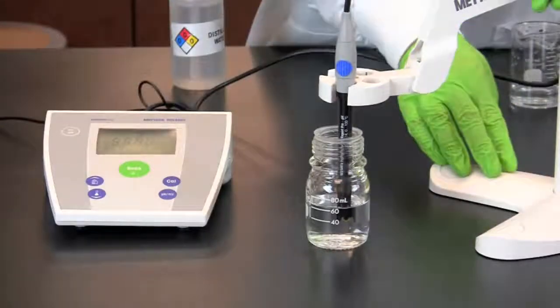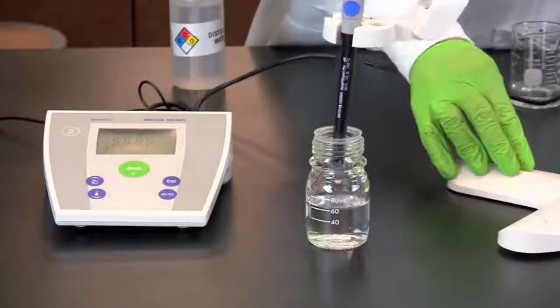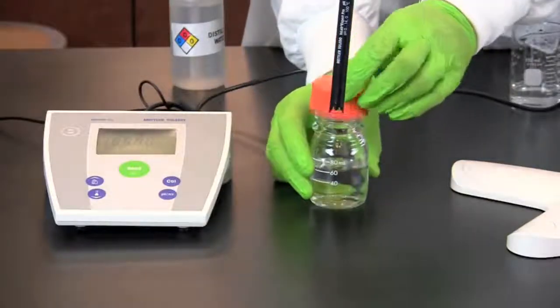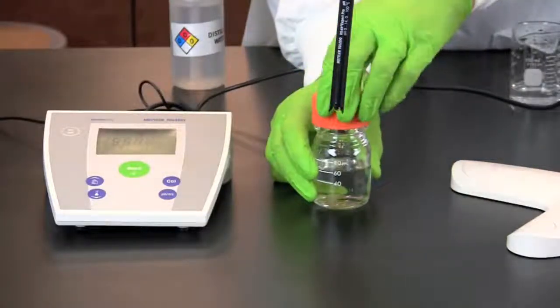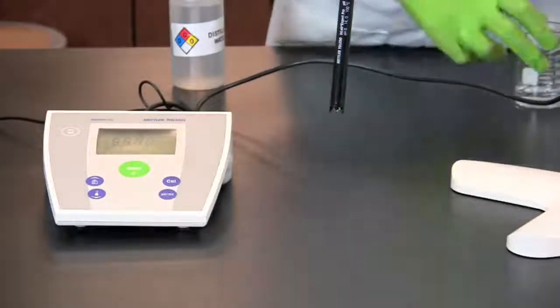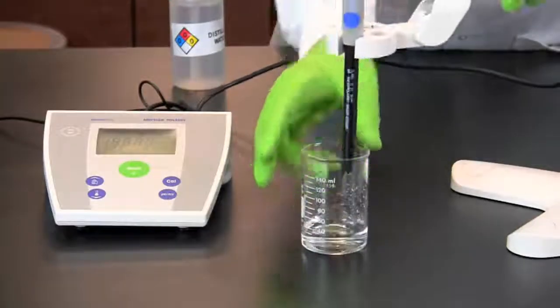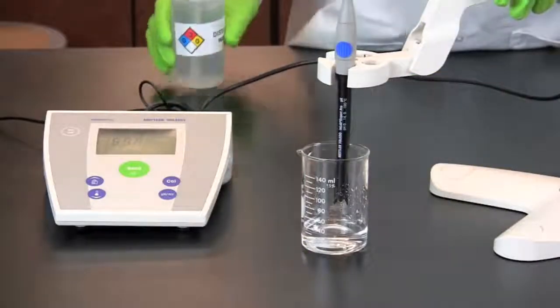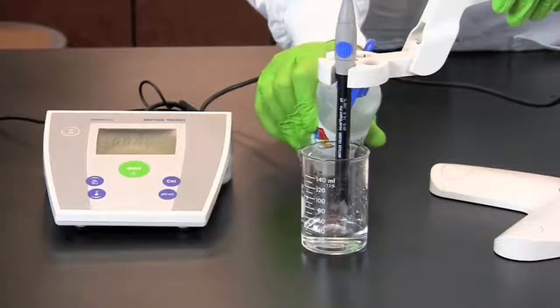Once the reading is complete, remove your sample. Once again rinse the electrode with distilled water.